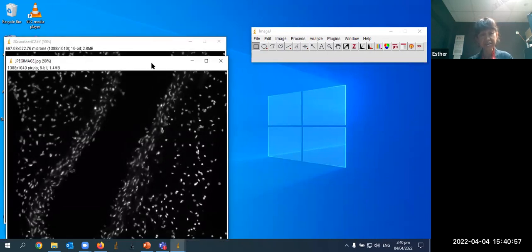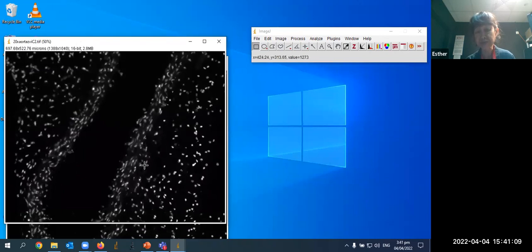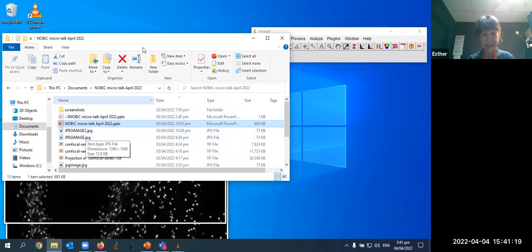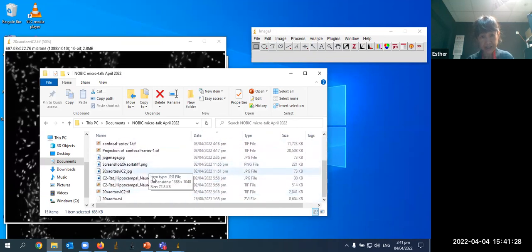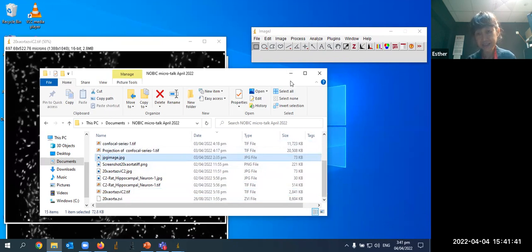But if we look at the upper left of each image, you see this image no longer has the measurement data. It only has pixels, whereas the original TIFF image has measurement data. So you can actually make measurements in this image. Okay. And just to show you that I wasn't lying about the file size, if you can see here, the original image is this one, 20x aorta. It is 2,841. The JPEG image is 73 KB.